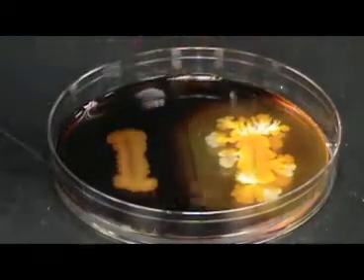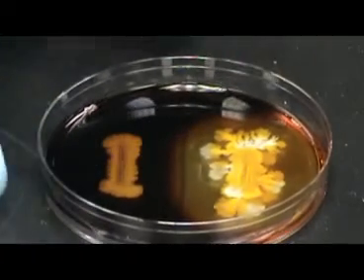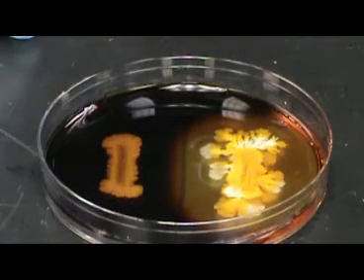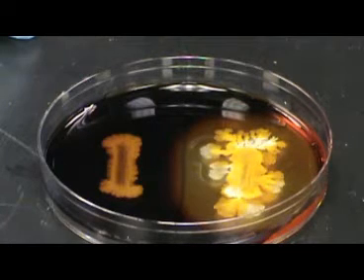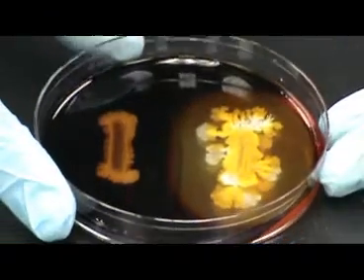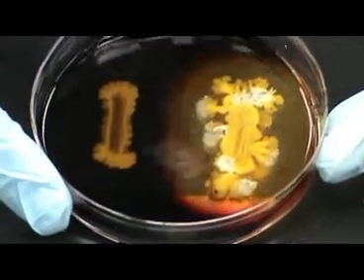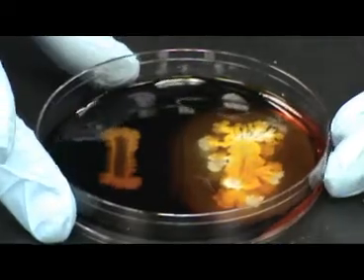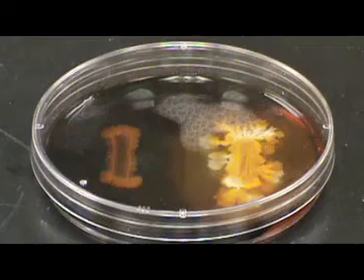If an organism produces the enzyme amylase, the amylase will be excreted out of the bacteria and into the agar, where it then diffuses. As the amylase diffuses through the agar, it will break down any starch it comes into contact with. As you can see here, the organism on the right produced amylase. This causes the clearing or halo seen in the agar after the addition of iodine. The organism on the left did not produce amylase, so the starch is still present in the media surrounding the organism.